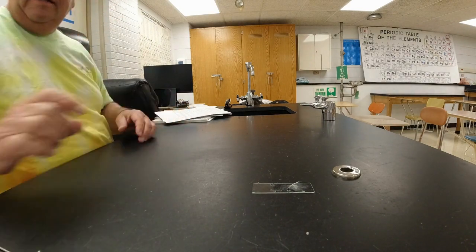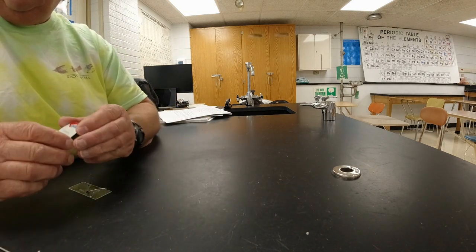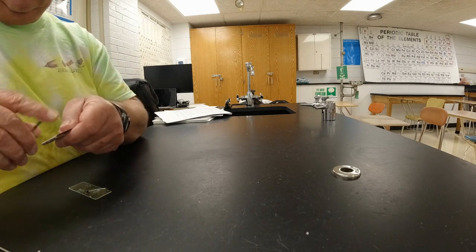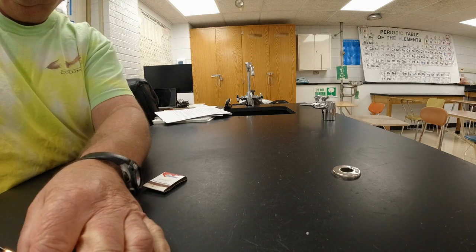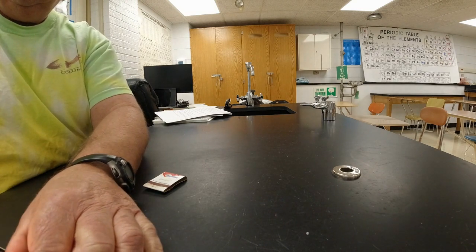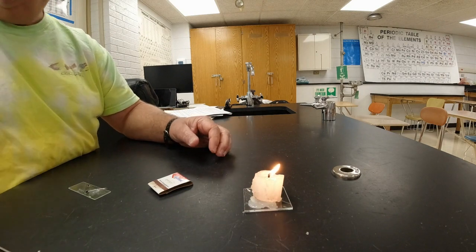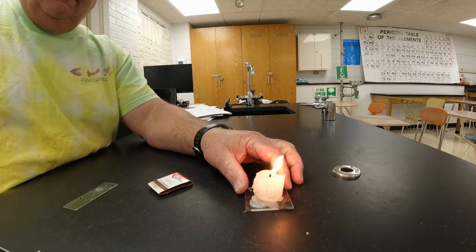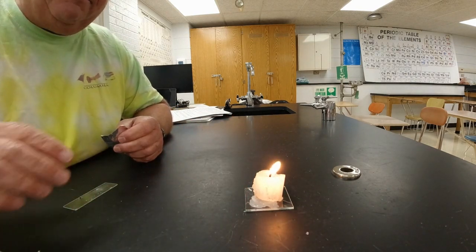All right, in number 7 here, we'll get this lit and we'll get it going a little bit first. All right, the most challenging part of the lab is step number 7.